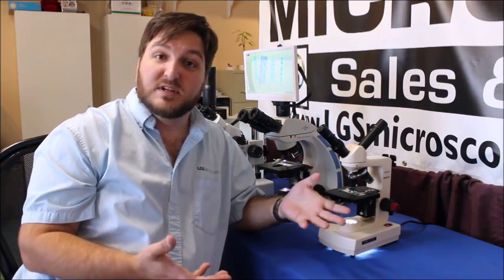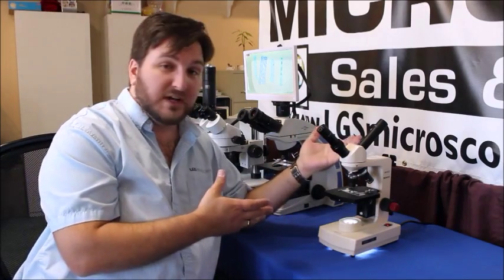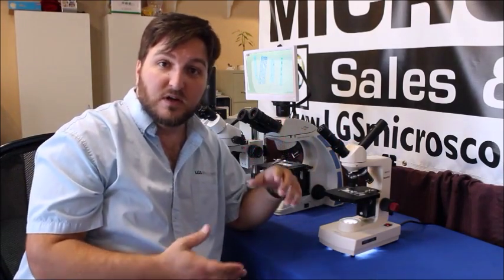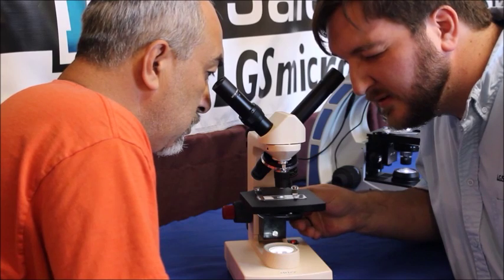Now the purpose of this is because not everybody's eyes are the same. You can fine-tune this for the second person now so that you can both see the same thing in focus at the same time.